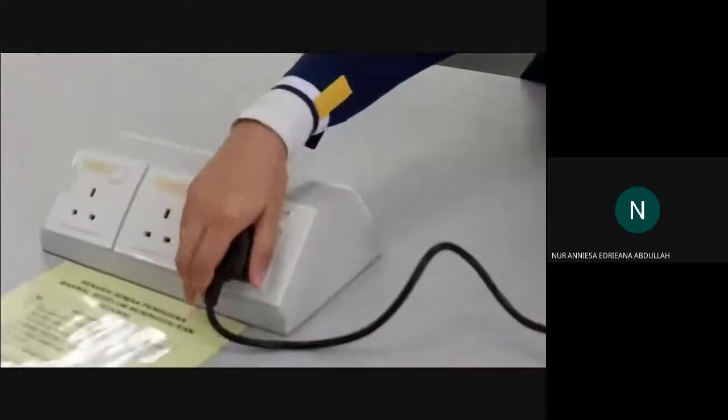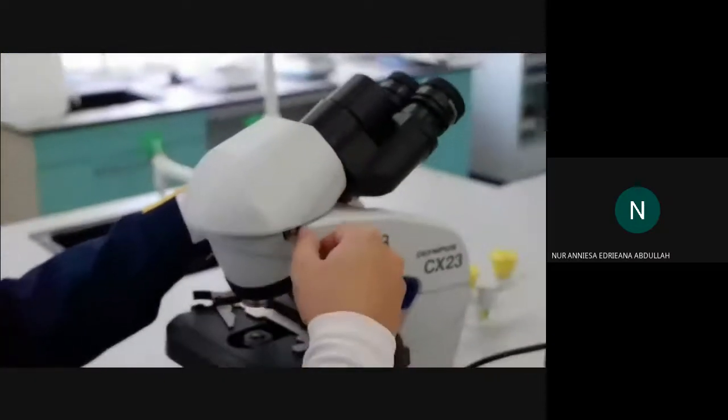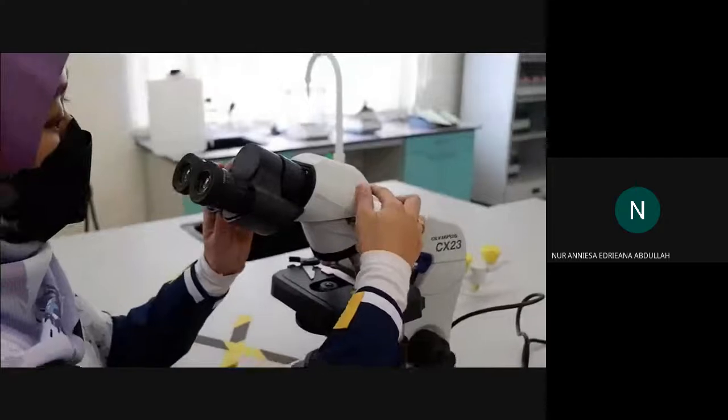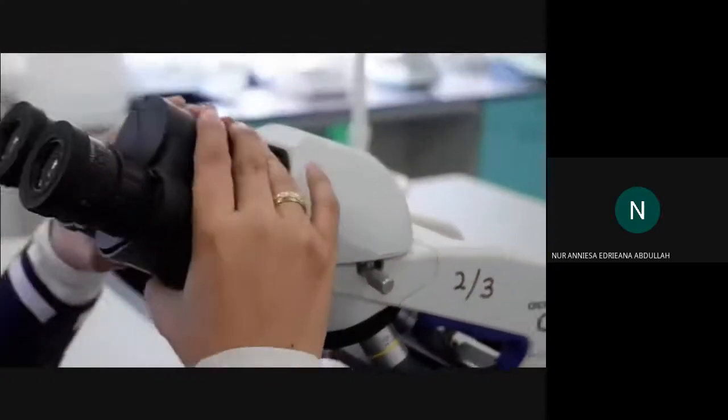Microscopes are usually stored in a dry cabinet. If you need to get the microscope, be sure to hold it right. Unwind the electrical cable and turn on the electrical power of the microscope. Unscrew the ocular lens and remember to adjust it to the placement of your eyes.